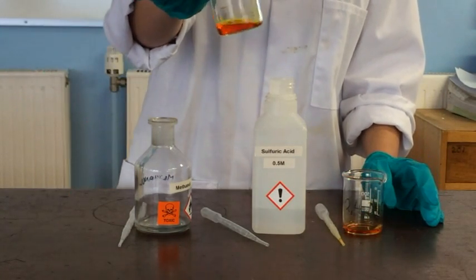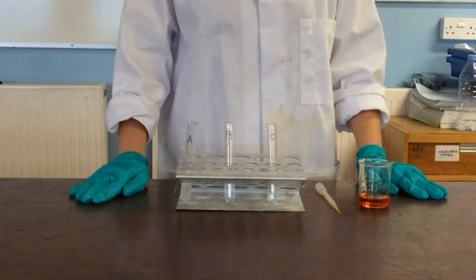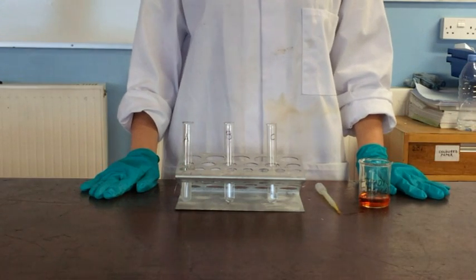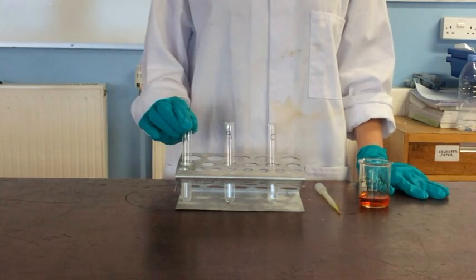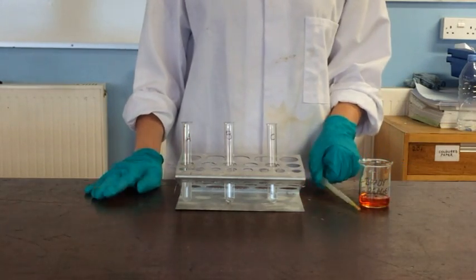And that is our Brady's reagent. Now I'm going to add Brady's reagent to our three unknown compounds. I've also added some methanol as a solvent and some sulphuric acid to make the reaction happen quicker.